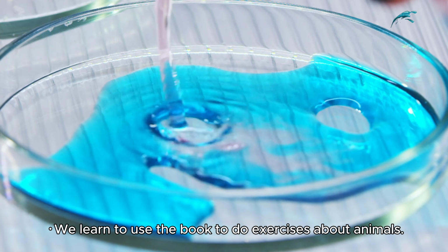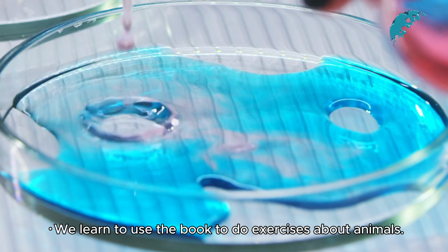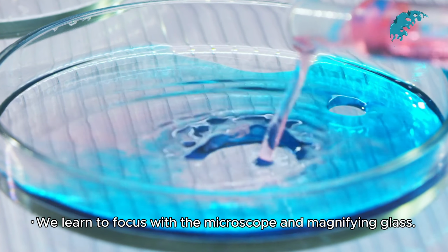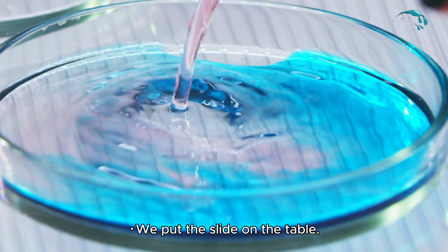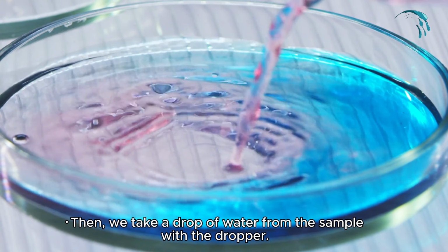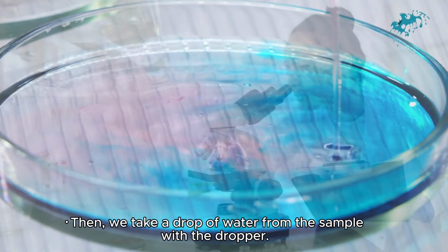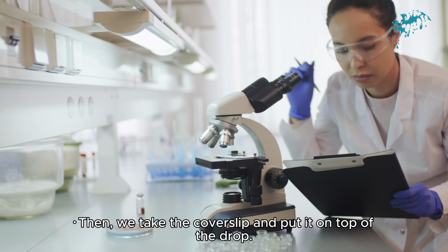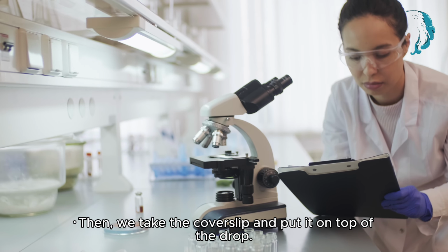We learned to use the book to do exercises about animals. We learned to focus with the microscope and magnifying glass. We put the slide on the table. Then we take a drop of water from the sample with the dropper. We put the drop on top of the slide. Then we take the cover slip and put it on top of the drop.